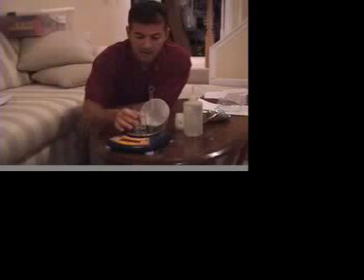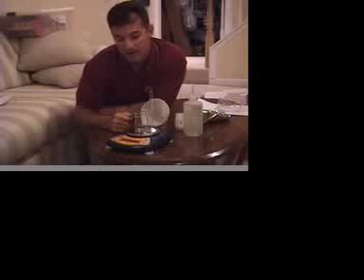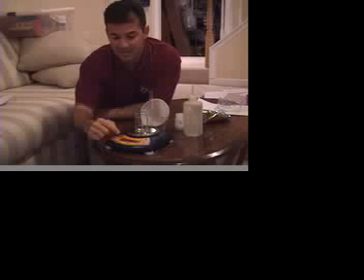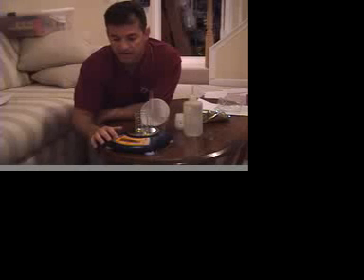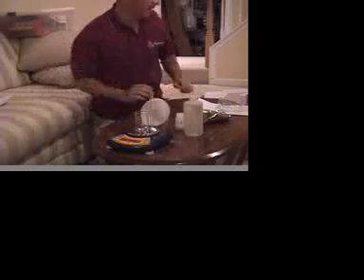So here's the deal. Get this guy plugged in. We're going to put this little glass on it. Now it's weighing the glass, so it's got this cool button here that says on, 0, off. When you put the glass there and hit the button, it actually resets the scale to 0. So you want to see that 0. Actually, this one says 0.0010, so I'm going to re-zero it again, ask the computer to calculate it.